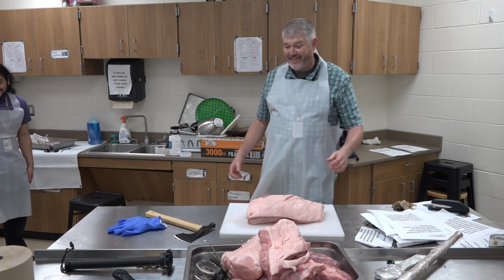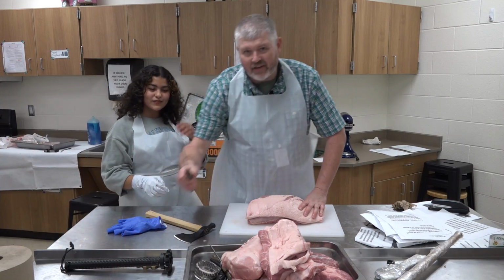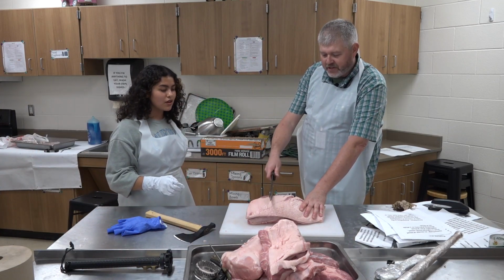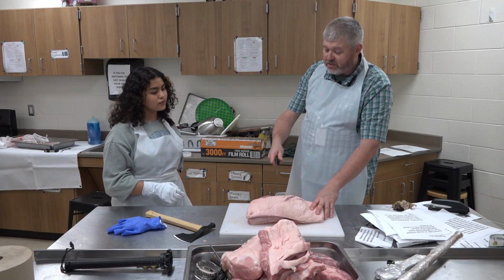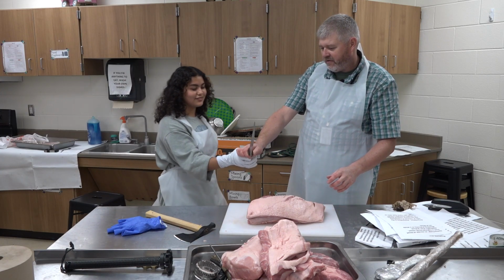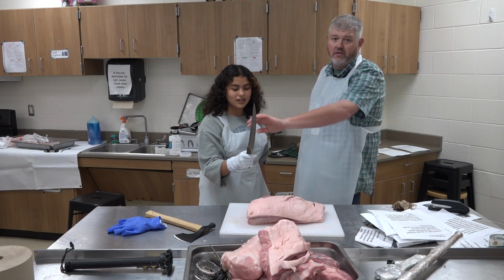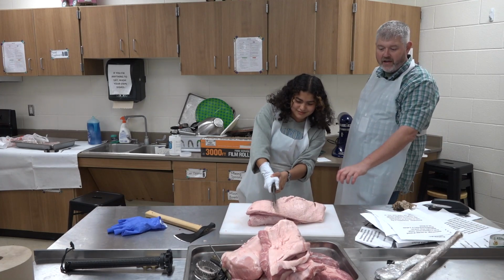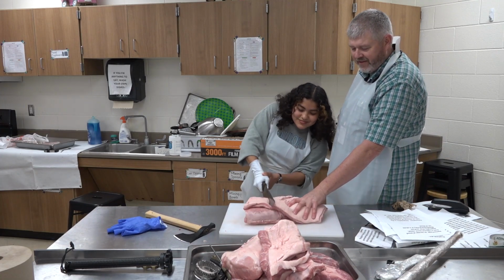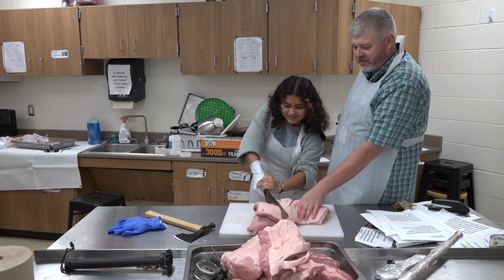Now here's the thing. With this, you're going to basically try to do one swack through it. And if it doesn't go, you're just going to keep sawing through it. This is literally how amputations worked in the Civil War time period. So one hit, right there. Now keep sawing back and forth. Keep going until it's all the way through.